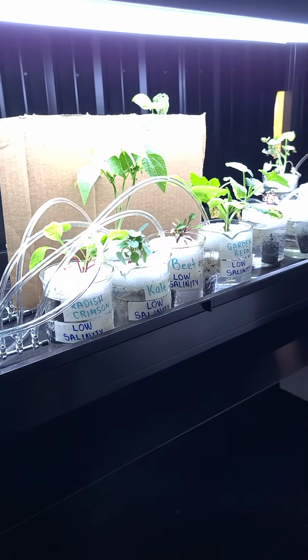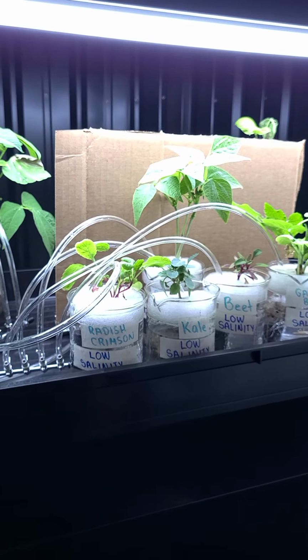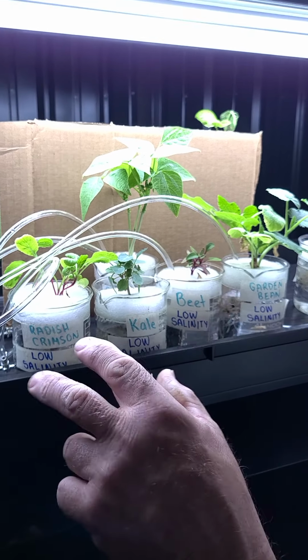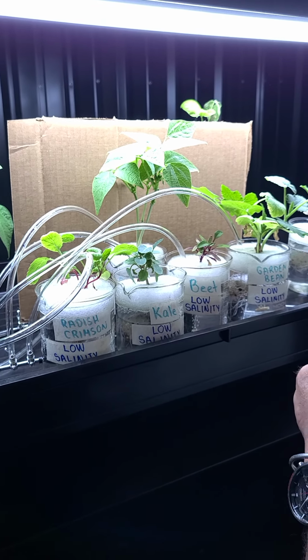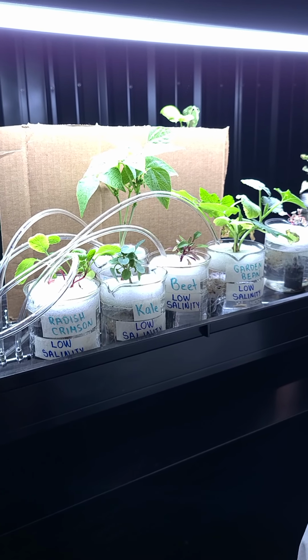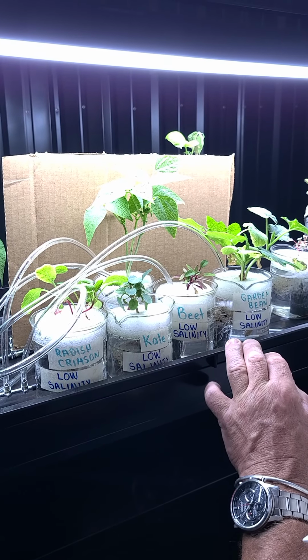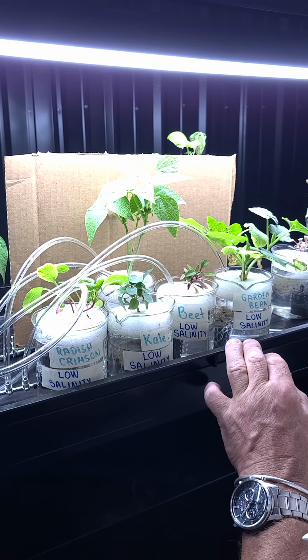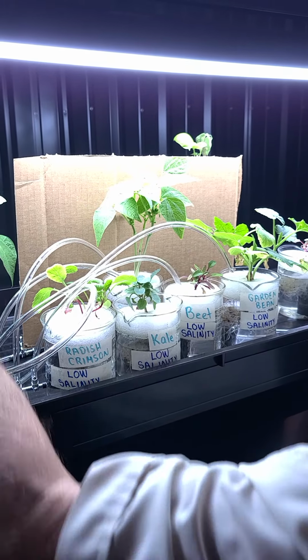Compare that with the control. A little different. I would say there's definitely a difference in the robustness, between the summer squash and the garden beans especially. You can really see that these are a lot different. These garden beans here are not nearly the same height as the garden beans on the other side, nor is the summer squash as robust as it was over there.